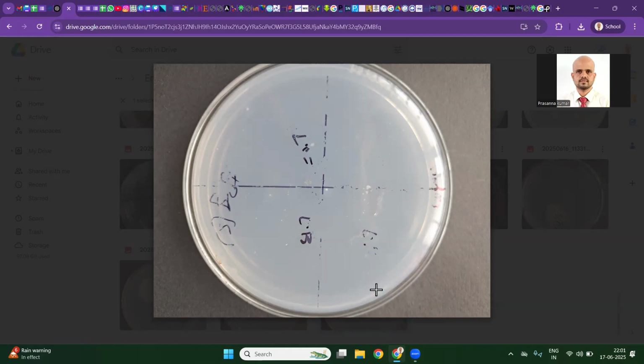So how to observe this? Let's start our observation. Ask yourself, is there any unexpected or excessive growth near the explant cut site? If you have growth near the explant, not on the explant, then there could be ineffective surface sterilization. In that case you will definitely get an imprint growth also. So we are going to examine imprints one by one.